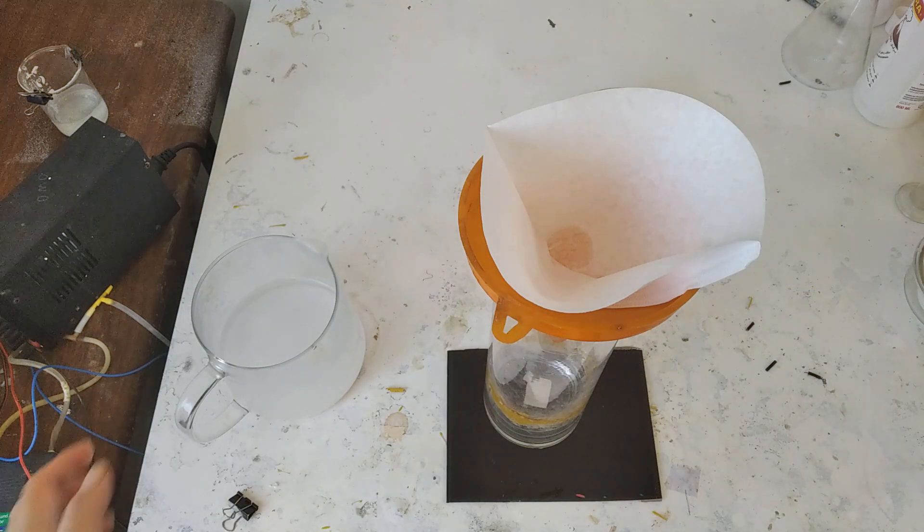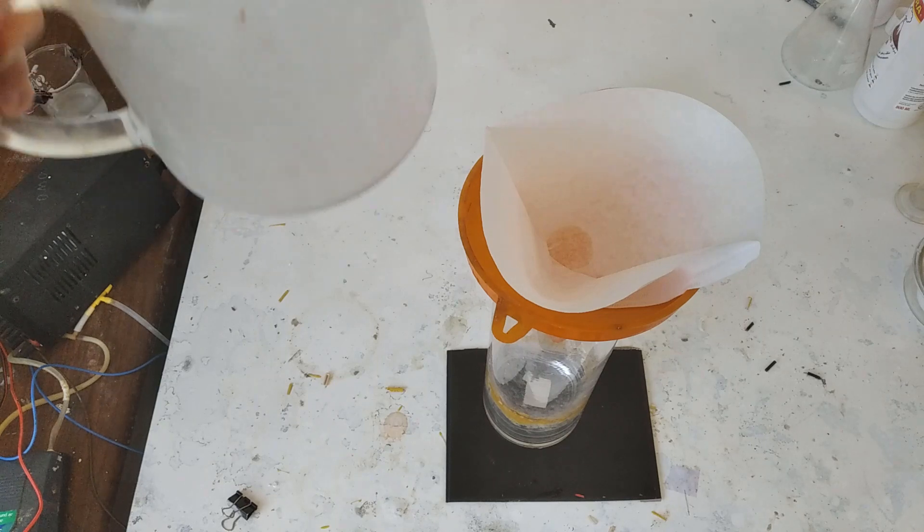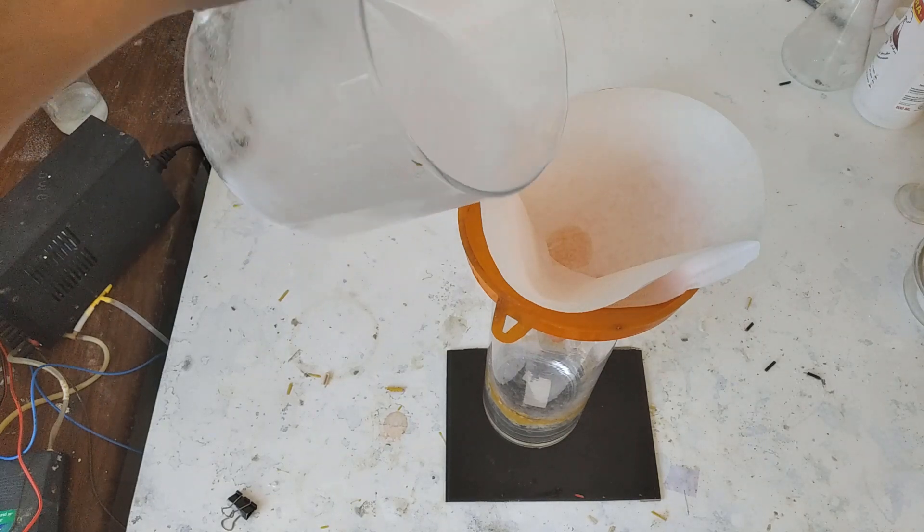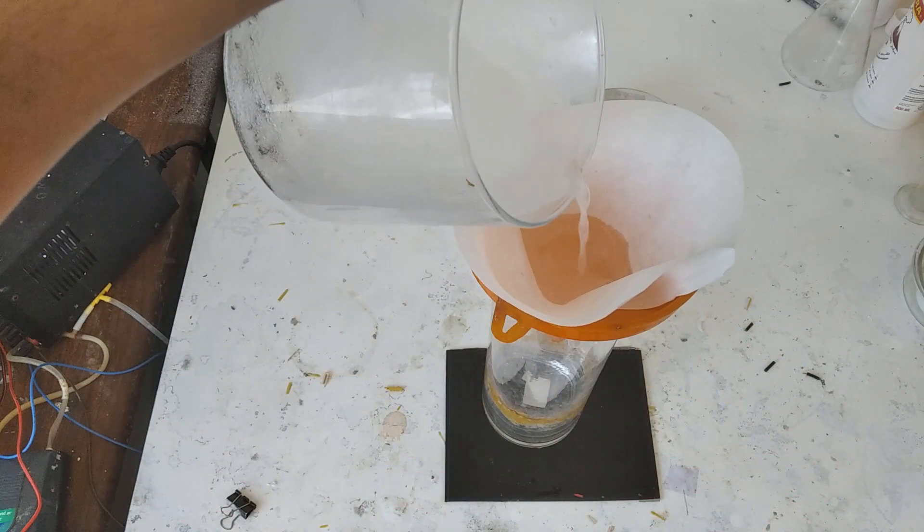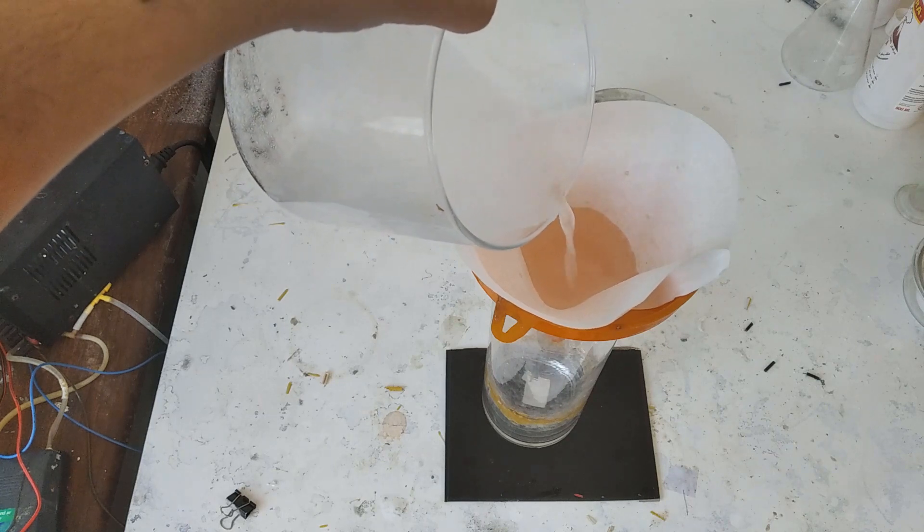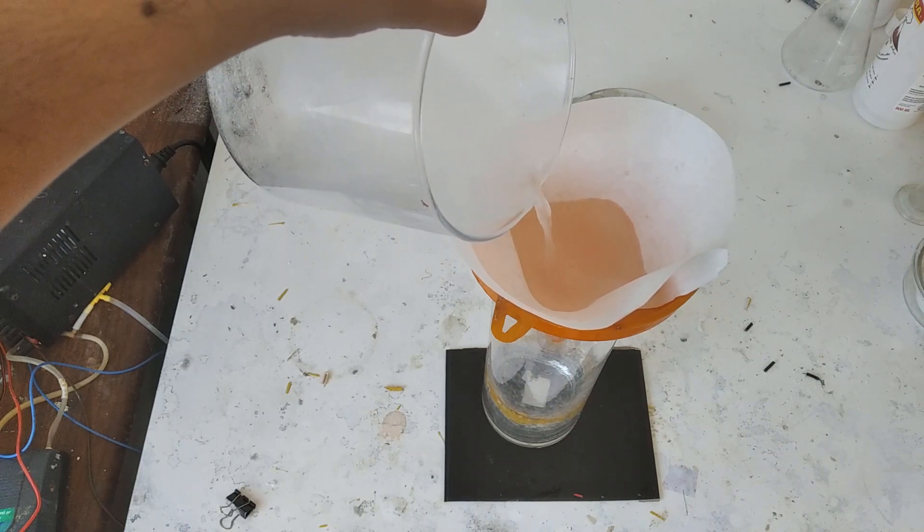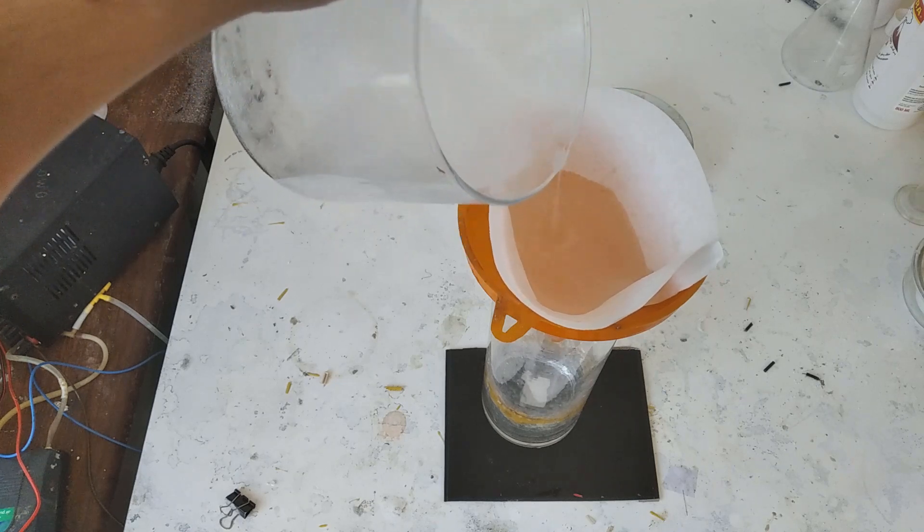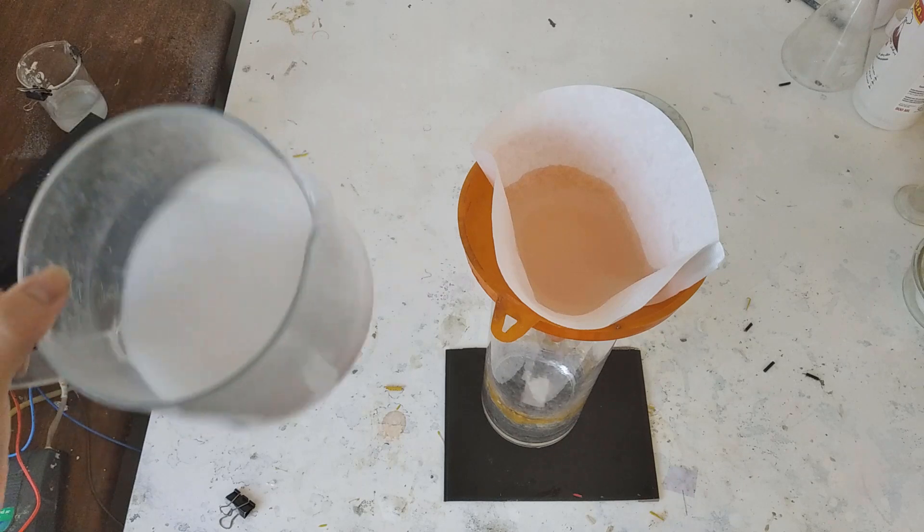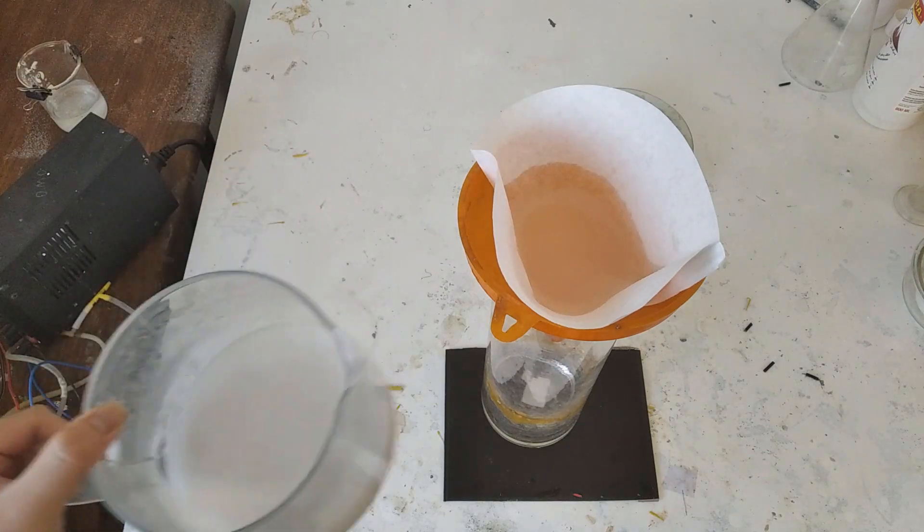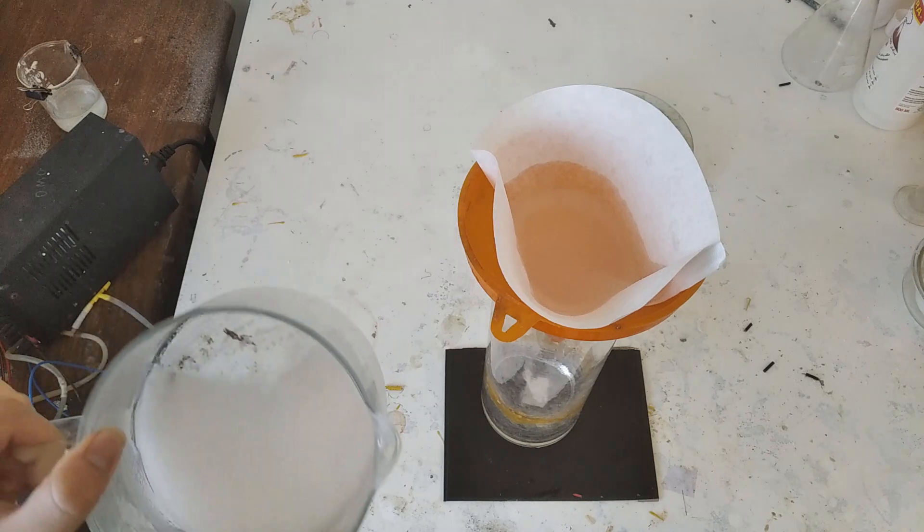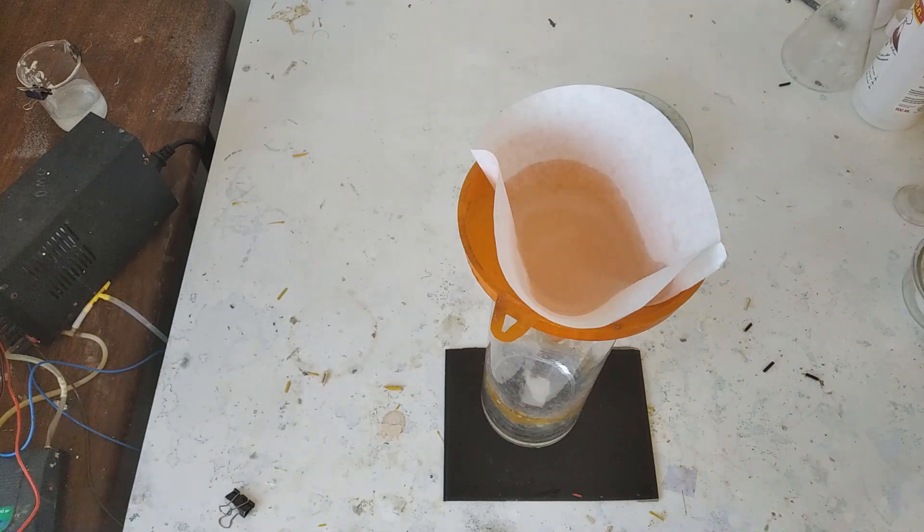Okay. So as you can see we have a lot of glutamic acid at the bottom. Now we're just gonna filter it and unlike that one guy I'm not gonna be tasting this for obvious reasons. One, I've used this container for other things and two, it kind of seems a little cursed. I'm probably gonna, I already know the taste because of that guy. He said it's sour, you know, and by that guy I mean that chemist.